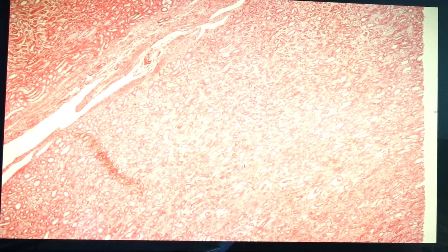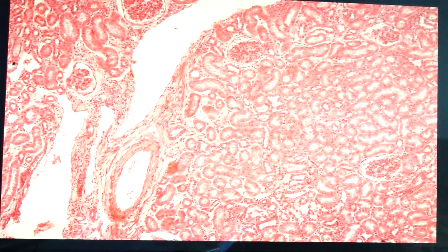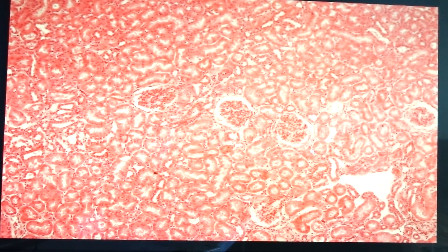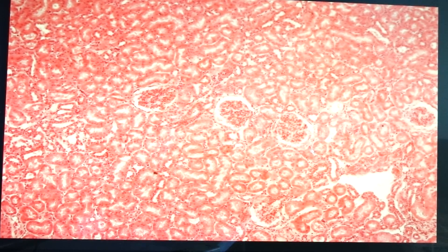So how do you identify the two regions? The cortex would show the presence of the renal corpuscle, or what we call the glomerulus. The lower, inner portion which would be the medulla is composed of tubules, so we do not see the renal corpuscle. So once you are located in this area, you would automatically say this is the cortex.